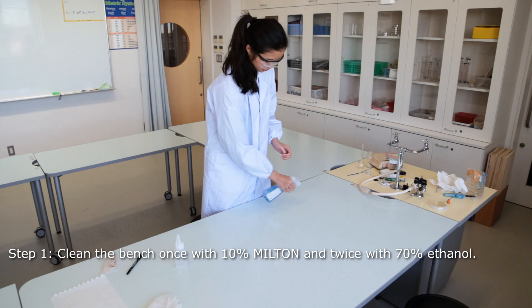A diluted 70% solution of ethanol is actually a more potent disinfecting agent than pure ethanol.